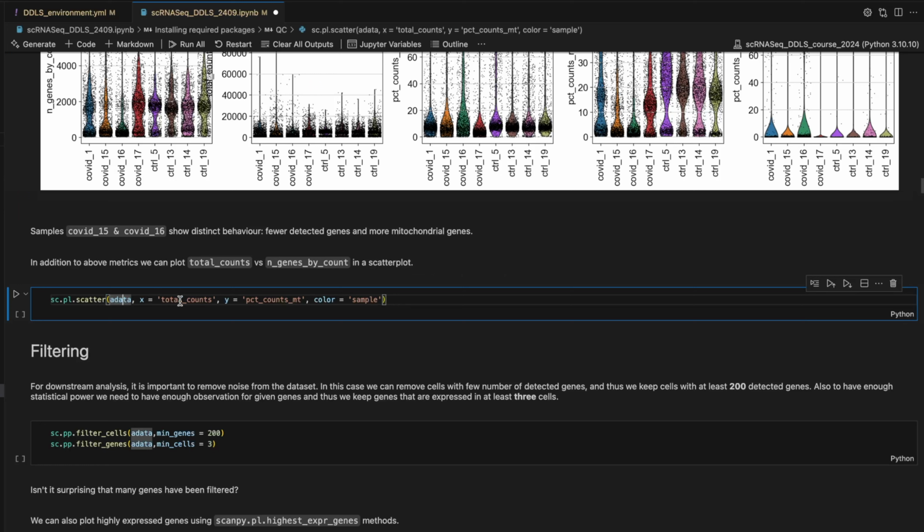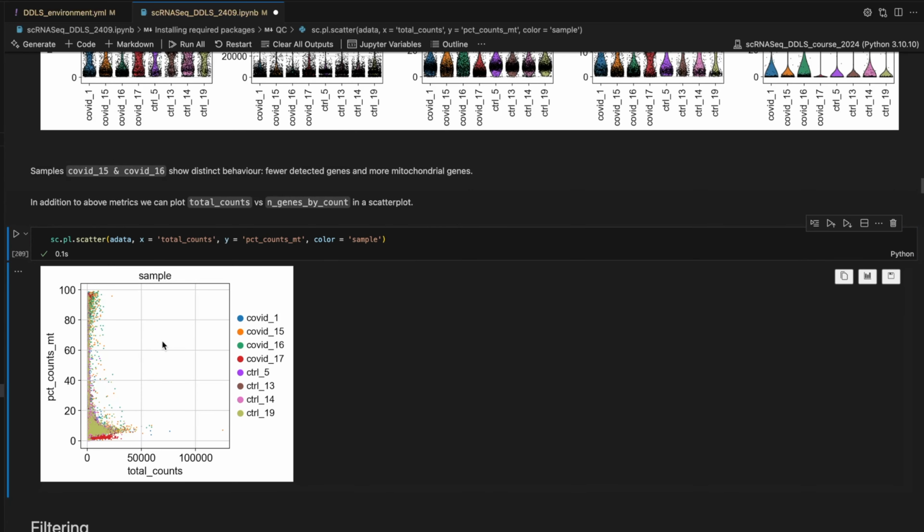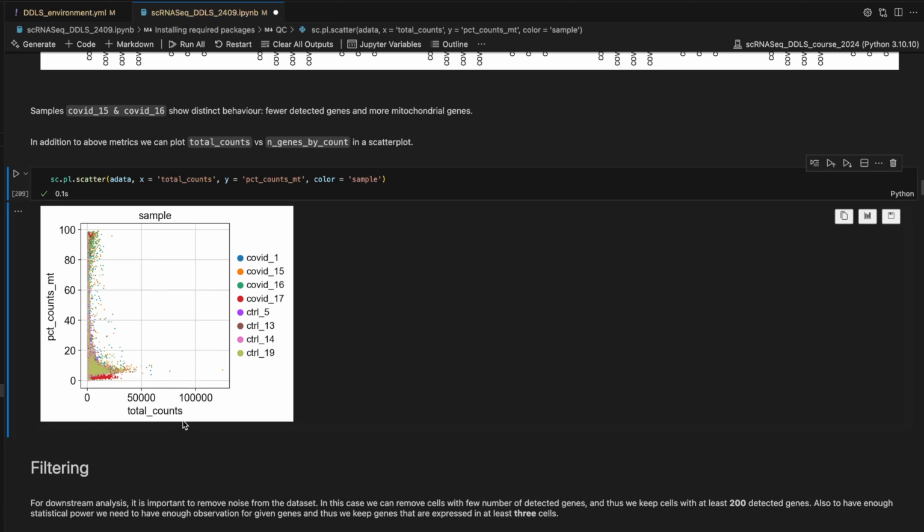But let's look at this from another angle. We would like now to plot total counts versus percentage of mitochondria using the plotting module and the scatter. We have the object, the X and Y values, and then we color by sample. So we have total counts on the X-axis and the percentage of mitochondria on the Y-axis.